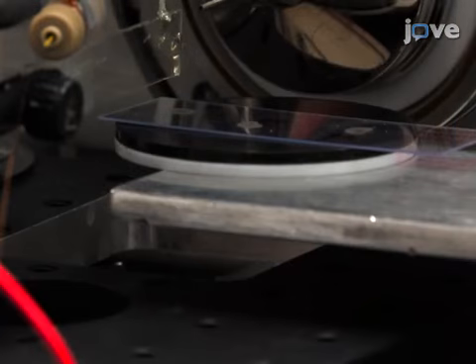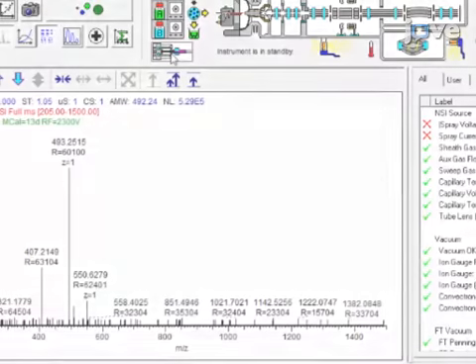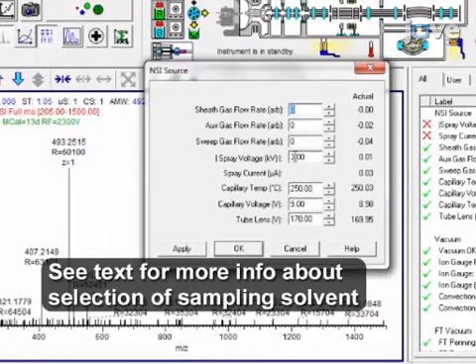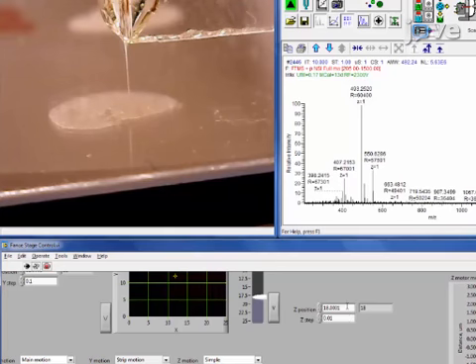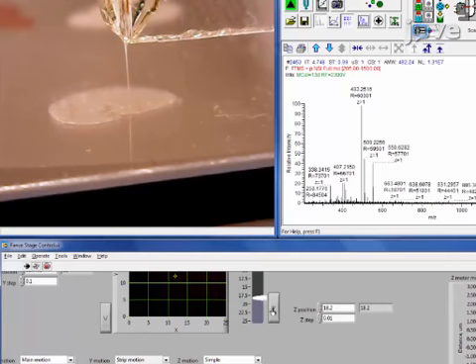probe. Adjust the sample position by changing the coordinates in the control software. Use the syringe to pump the sampling solvent at an appropriate rate, and then apply the ionization voltage. Adjust the height of the single probe so that it is resting just above the surface of the sample and able to perform surface extraction of metabolites.